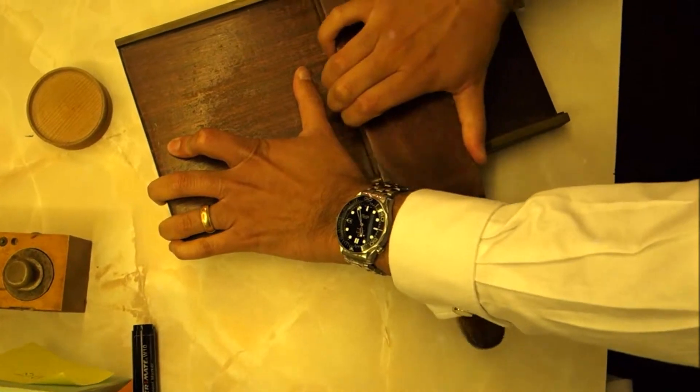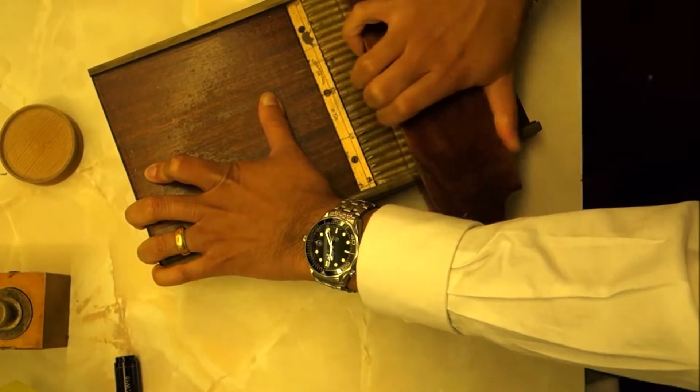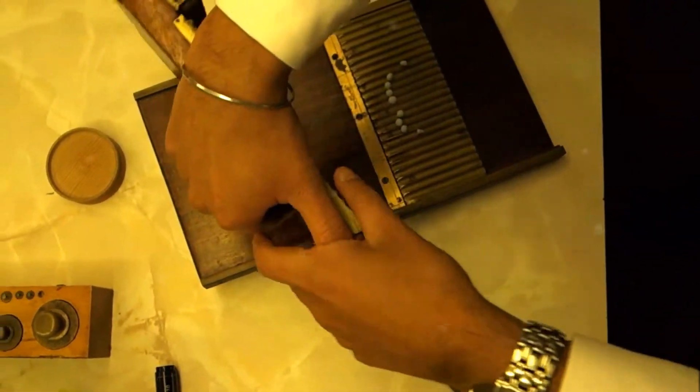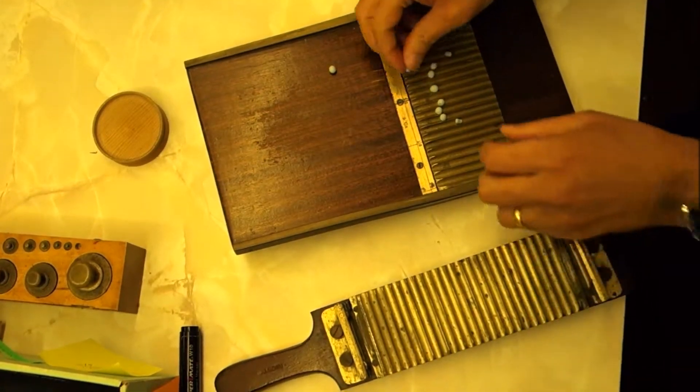Now we're going to roll this over here. Look what happens. Round little tablets.